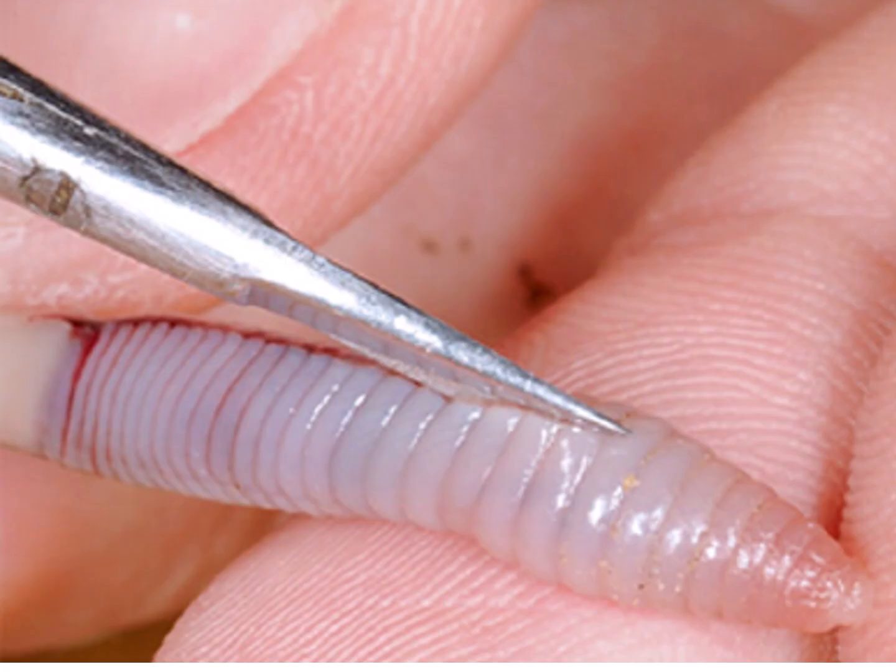Keep the points of the scissors up, and cut forward from the clitellum toward the head up to the prostomium, that is a lobe-like structure before the mouth. And then we place this earthworm in the dissecting plate ventral side down, and pin the skin on the sides of the earthworm to observe the internal organs.